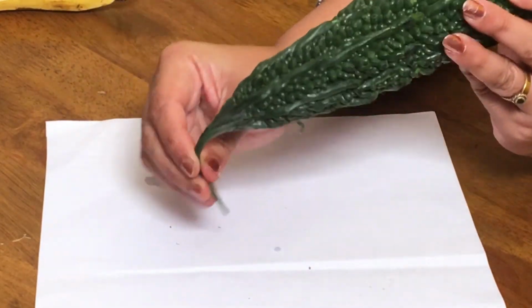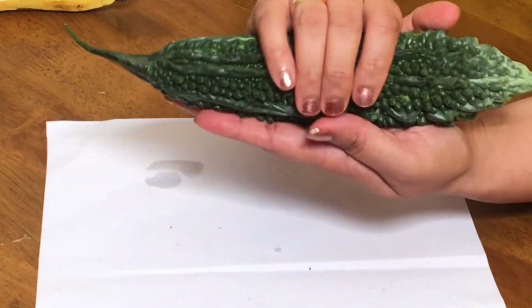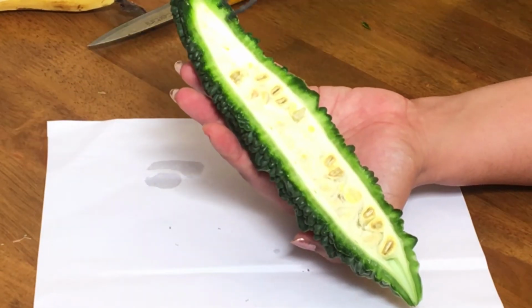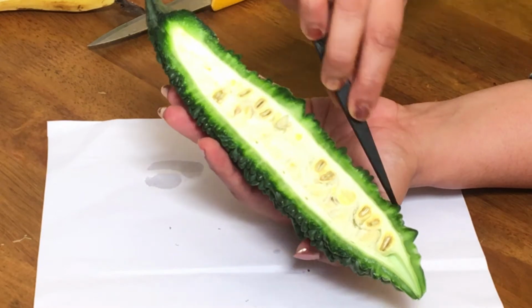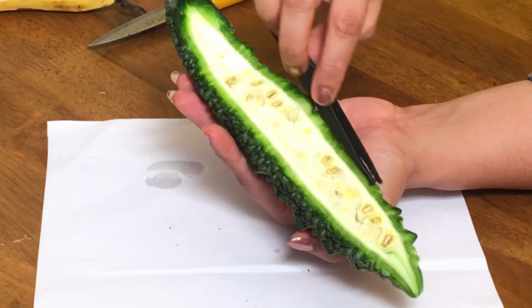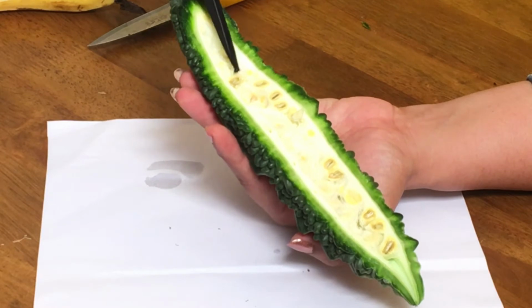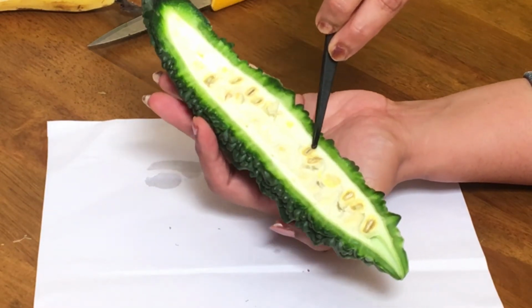This is a stalk. This was the stalk of the flower, and this is the ovary. This fleshy part, which is edible, is the wall of the ovary, and there will be seeds inside. You can see here, this is the pericarp, which is divided into epicarp here. Epicarp and mesocarp are fused together, and this white part is the endocarp, and inside you can see all these tissues. These are placental tissues and also seeds. You can find a lot of seeds inside this.